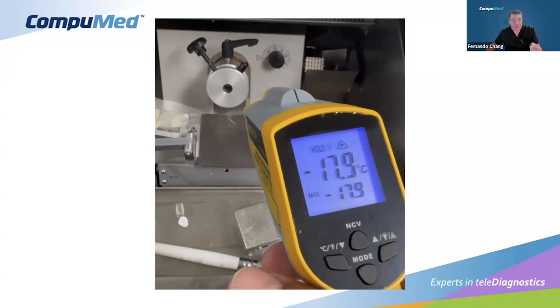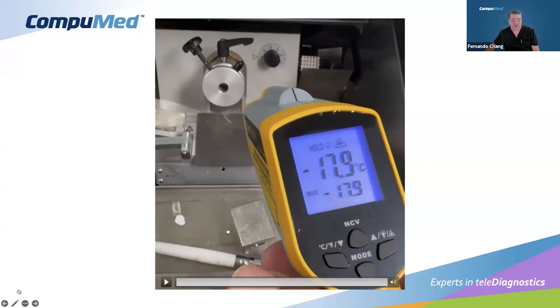That's why I said in the previous slide, remember -17, -18, because this is the ideal temperature that is happening. And very unfortunately, I don't have the temperature in the back of the cryostat. The back of the cryostat was at -23, but the stage is at -17.9. And this is exactly what I would try to do. It can really be learned by practice. You can practice the sectioning and you will see that the ideal temperatures range between -17 and -18, even -19 degrees centigrade.